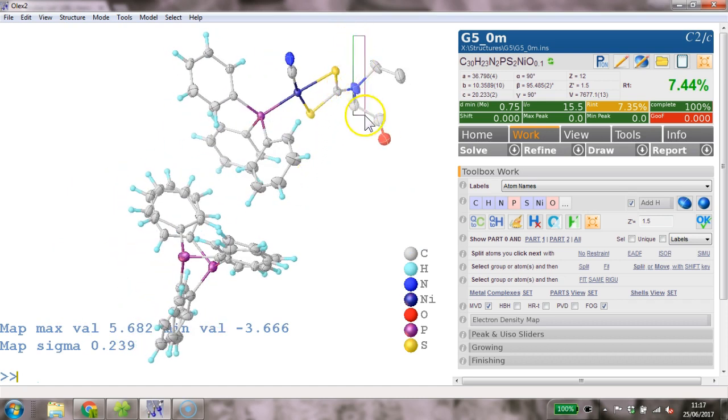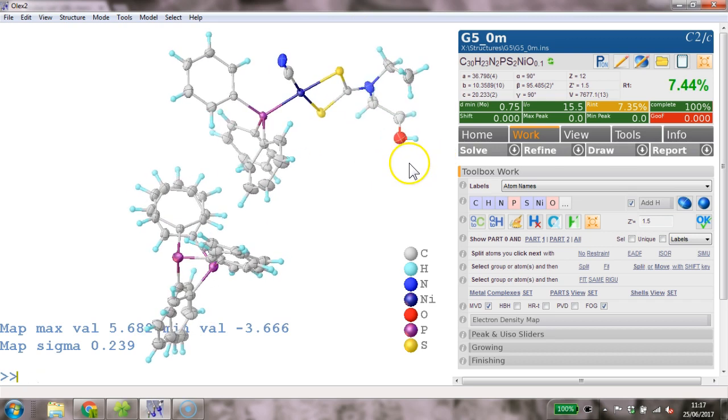So first of all, I would select all of those and type HADD. So see what happens. Well, this hydrogen here, assuming this is not a double bond and therefore an aldehyde, but assuming this is actually an OH, so this has done the wrong thing. This bond looks a little bit long as well, and that's fine.